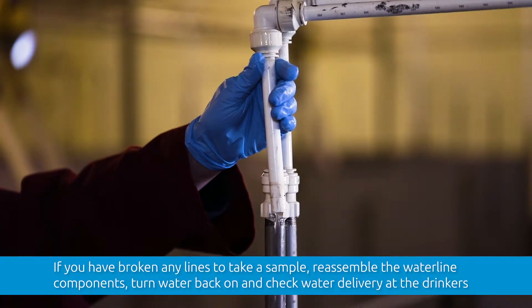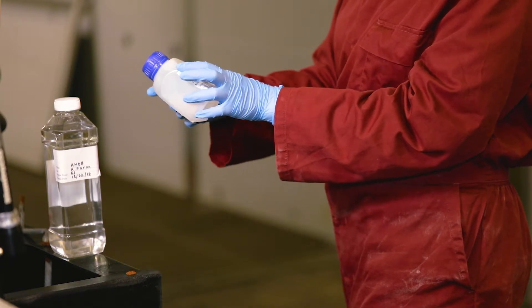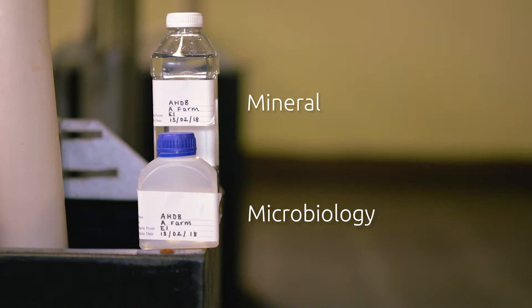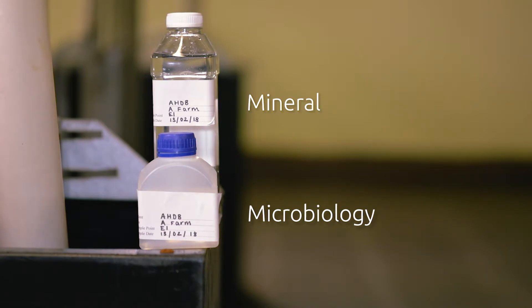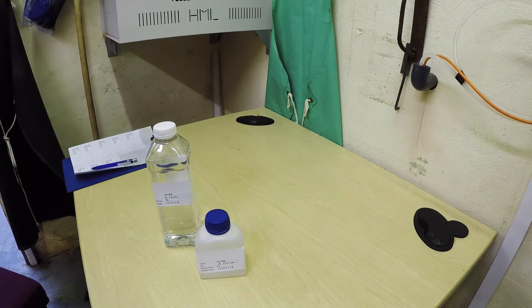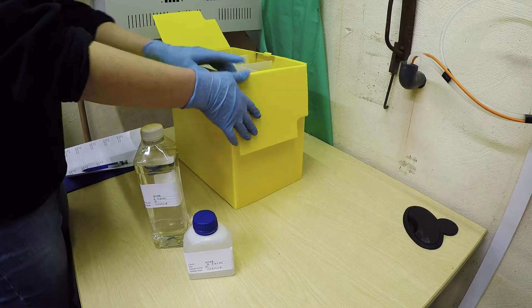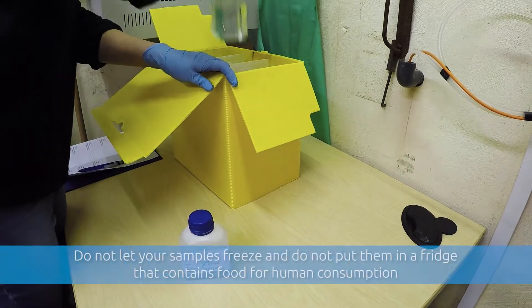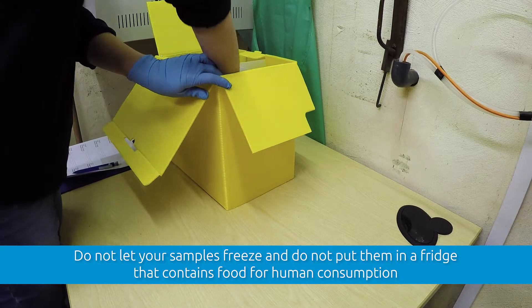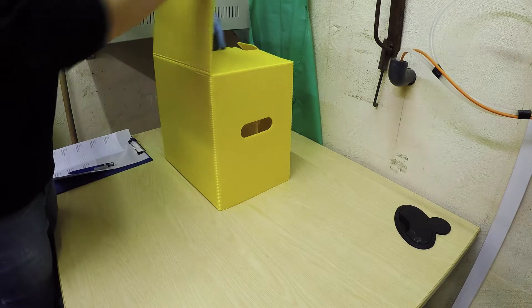Once all bottles are filled, dry them and affix the labels. You'll need to follow this process for collecting both mineral and microbiology samples at each point. It's important to remember that some analysis is time crucial and samples must reach the laboratories within 24 hours of sampling. Once all of your samples have been taken and labelled correctly, keep them chilled at 3-5 degrees Celsius and out of direct sunlight.